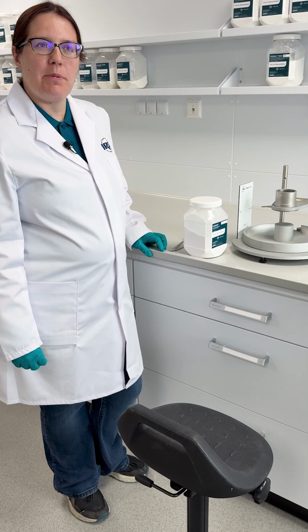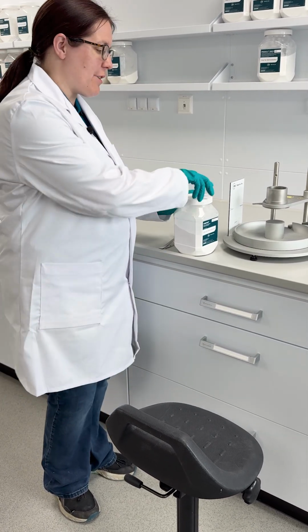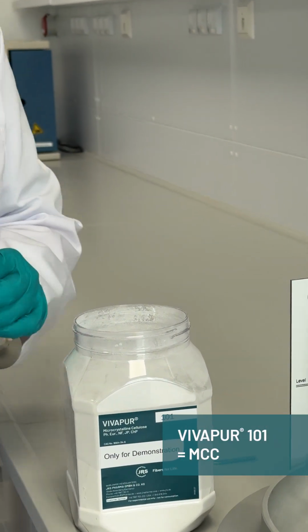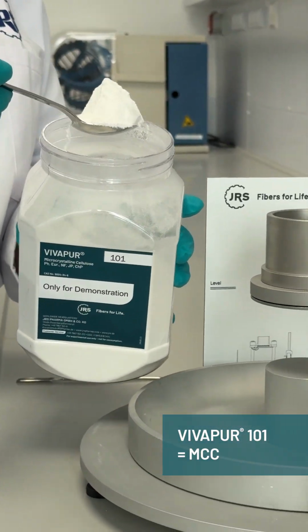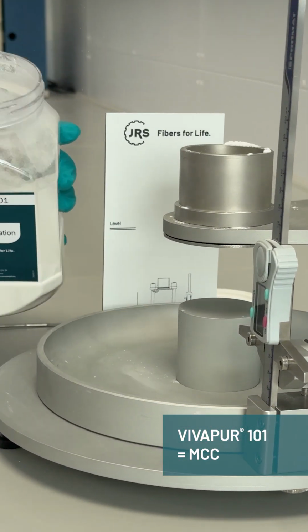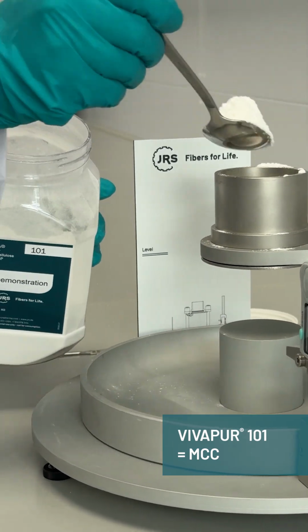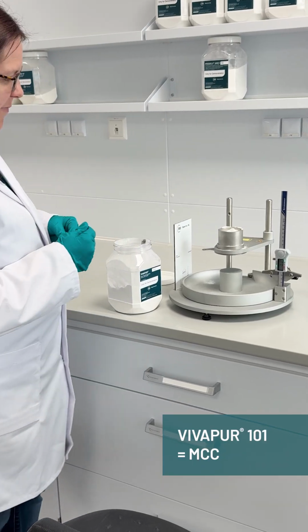And now we'll take a look at a powder that is typically used for granulation rather than direct compression, and so is known to be less flowable, but is good for mixing with the API to make larger granules. And even here you can see on the spoon that it's a much less flowing powder. So again, I'll fill it, and I'll have my spatula ready.